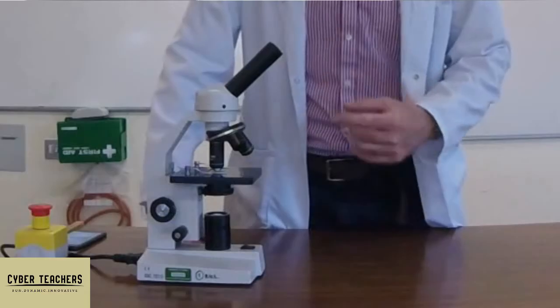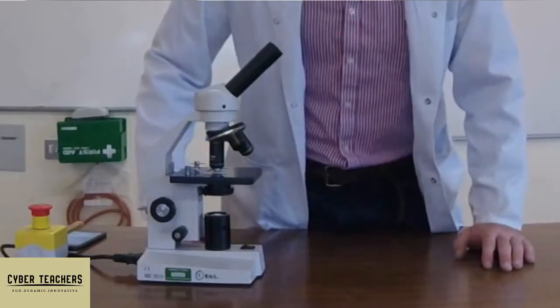Hi guys, today let's take a look at really small things — microscopy. Welcome to GCSE required practical number one: using a microscope.